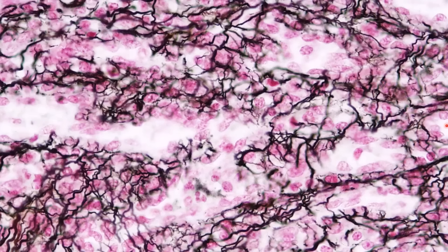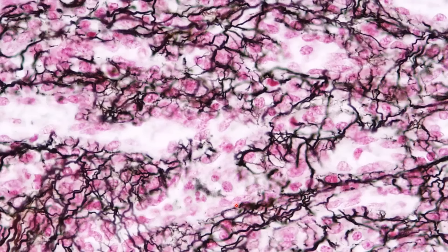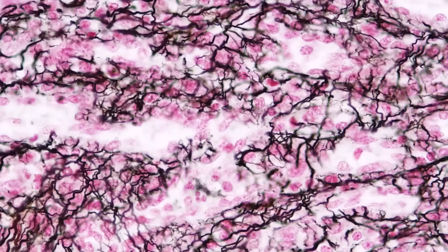You're seeing black fibers that are making a net, which lets you know you're looking at reticular connective tissue.